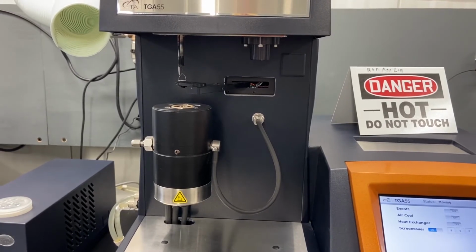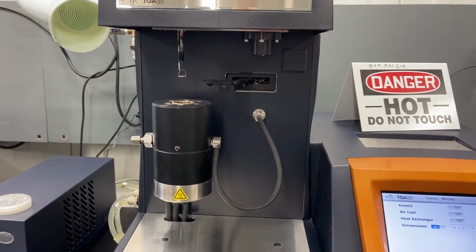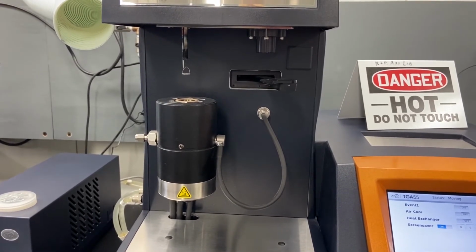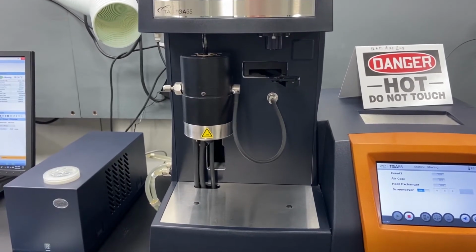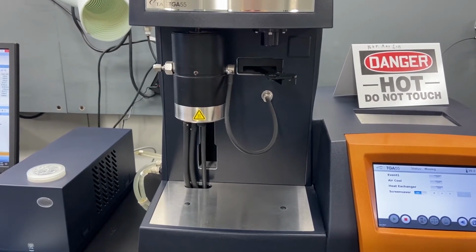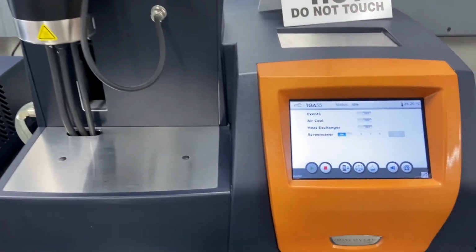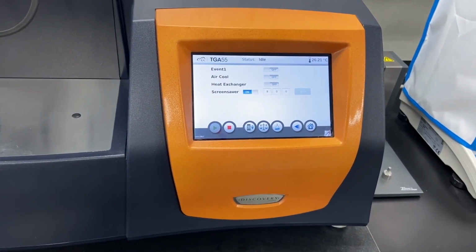New England Wire Technologies uses the TGA to determine the volatile content of material, at what temperature and rate volatilization takes place, to examine the decomposition and oxidation of materials, and to determine the residual mass after the sample has been reduced to ash, which can be an indicator of inorganic content like mineral fill. This information aids in identification of customer samples as well as new product and process development.